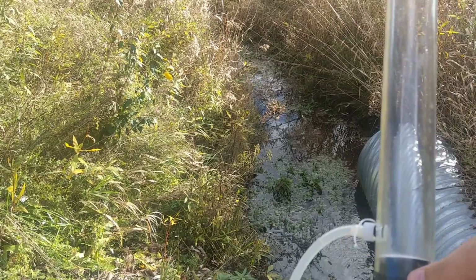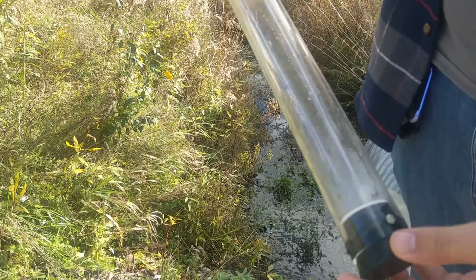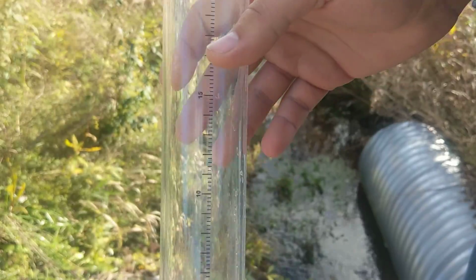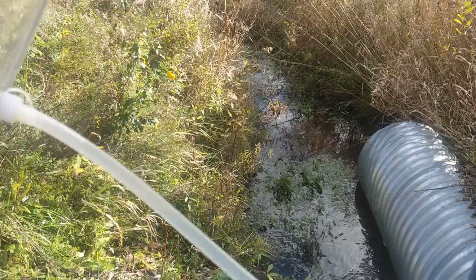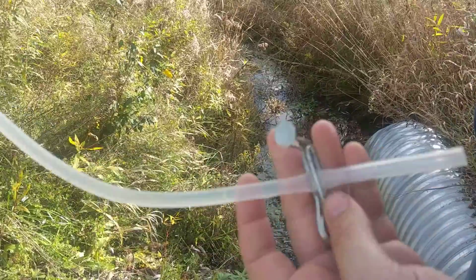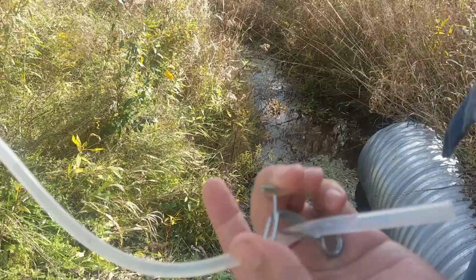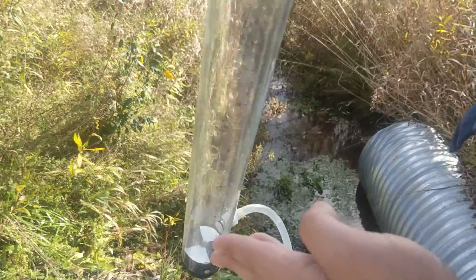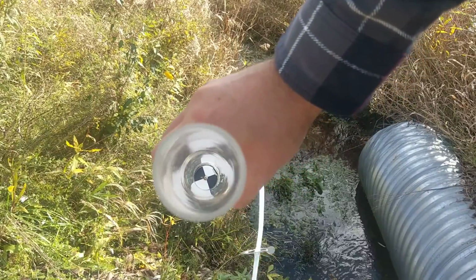All right, we are going to be doing turbidity next. This is the tube that we're going to be using, and you'll notice there are graduations in centimeters going up, increasing to the top. There is also a tube on here and a little stopper which releases water when you squeeze these two together. There is a pattern on the bottom here, which if you look through the tube, you'll be able to see the pattern.